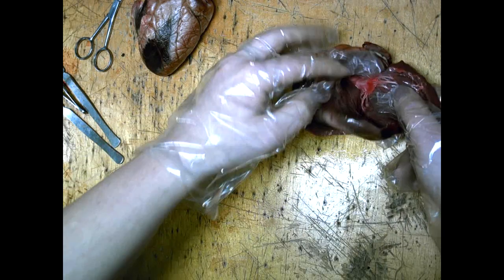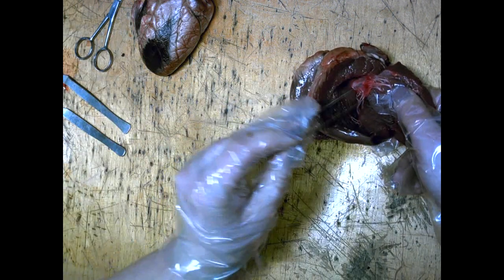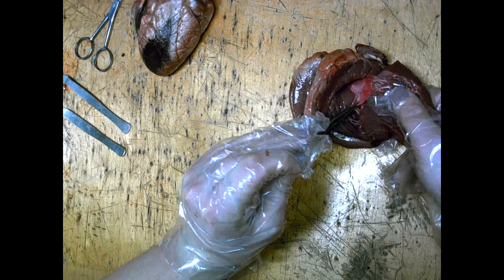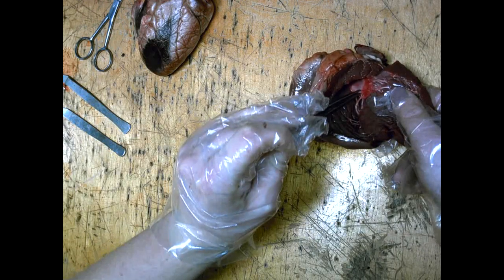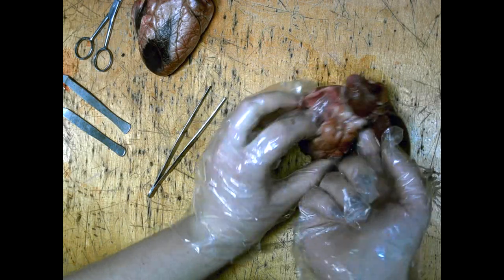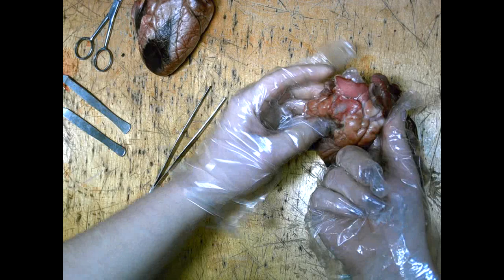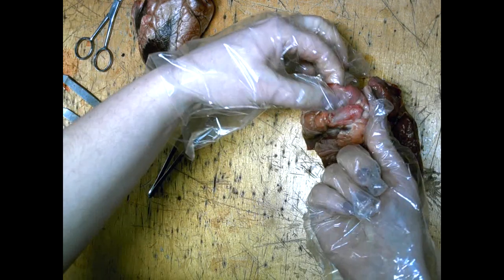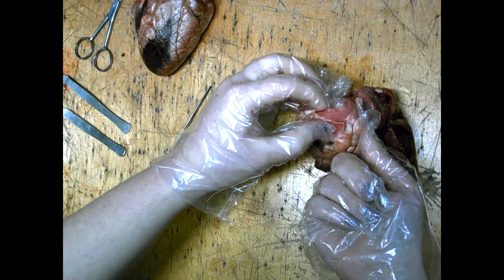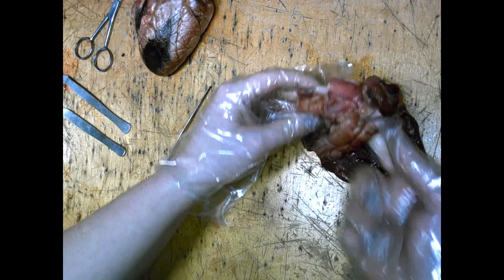Inside the heart, you can see the valves that are linking the atrium at the top to the ventricles. These valves control the flow of blood through the heart. You can then see at the top the aorta. The aorta is the artery that leads away from the heart. The walls of the aorta are thick and elastic because the blood is leaving under high pressure.